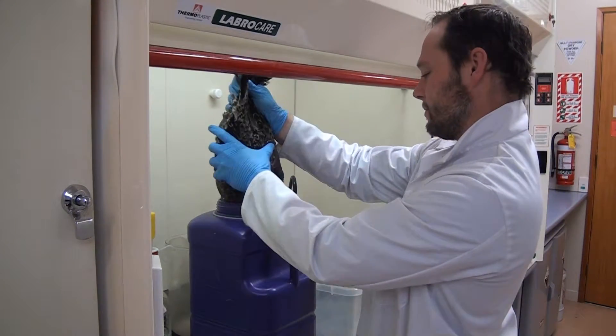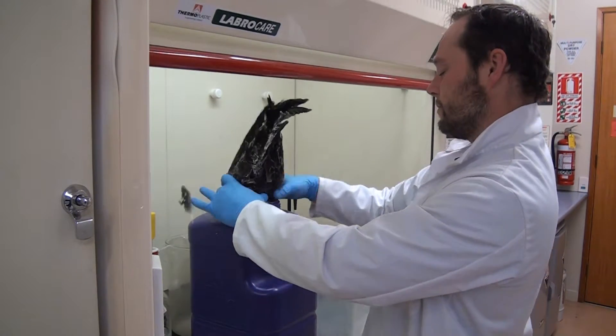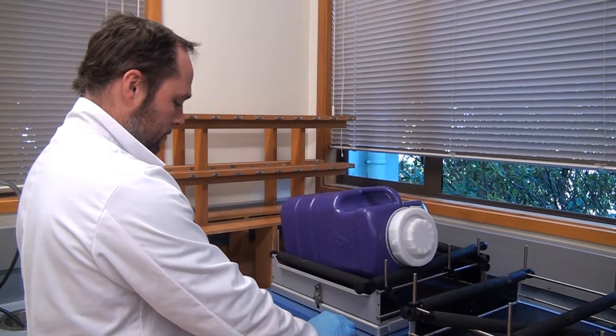So I use solvent, take the material that I want to extract, put it in a large solvent proof vessel, shake it for about an hour or so.